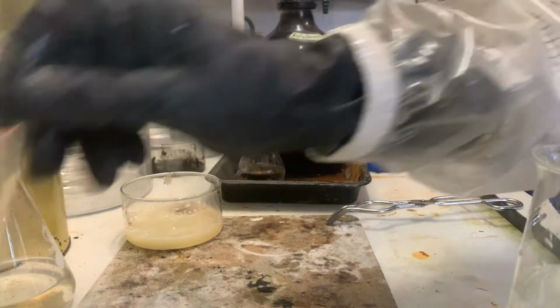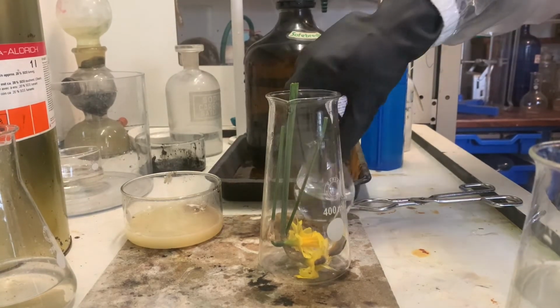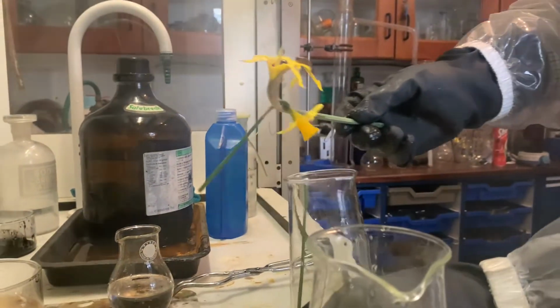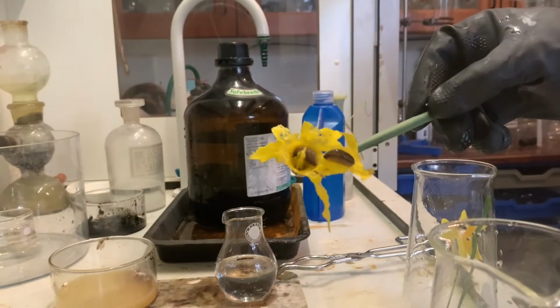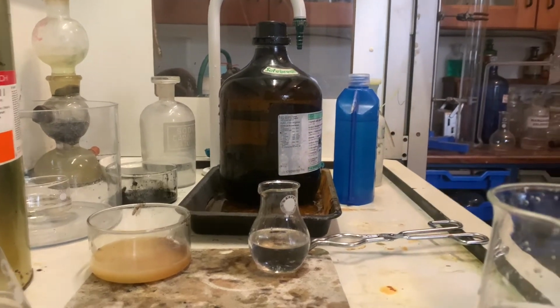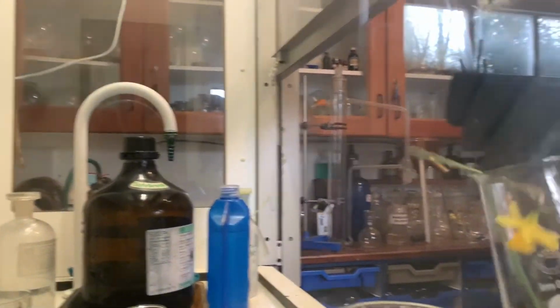And the last little demonstration I'm going to show you is just adding some sulfuric acid to some flowers. Now it's very, very important. Oh, I've just discovered, look at that, two very lucky snails. We're about to get roasted, so I'll put them outside to keep them safe. Just check there's nothing on these. Yeah, so we've just got two little daffodils.